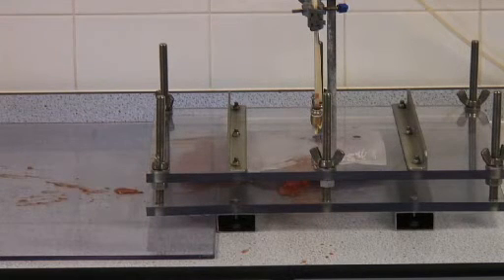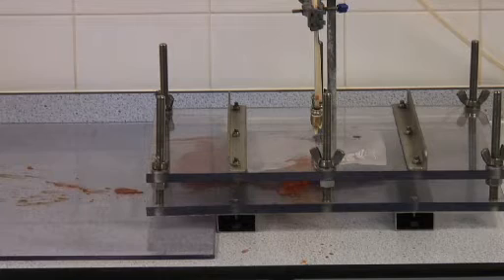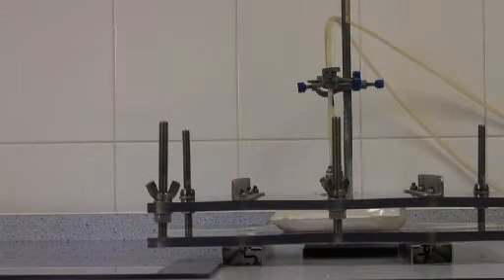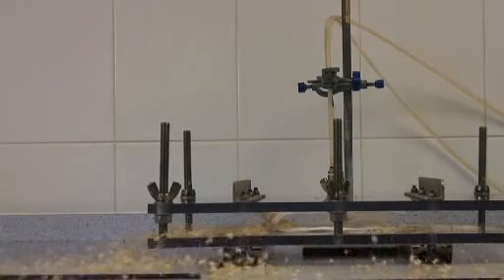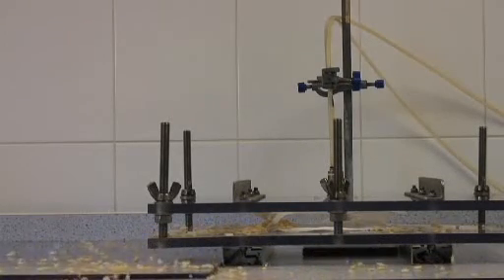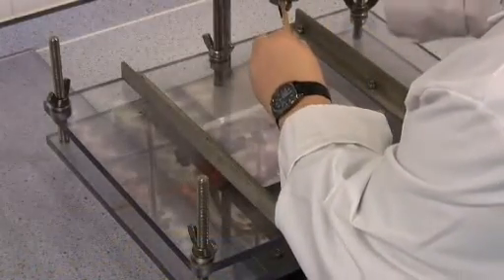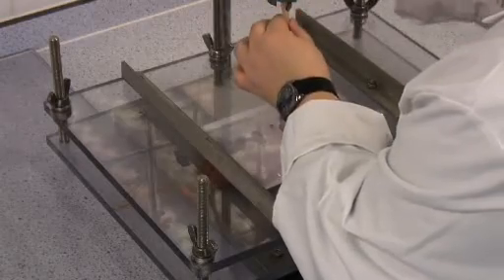The pack bursts and this indicates if there's any defects or weak areas in the seal, or just gives a reading of the strength of the seal. The pressure is recorded at the point at which the pack bursts.